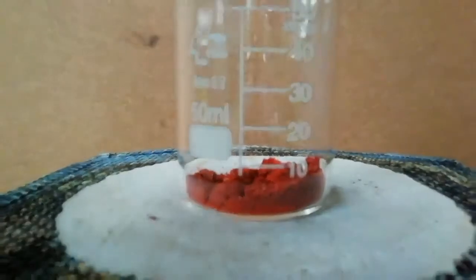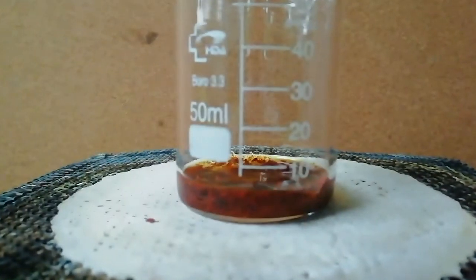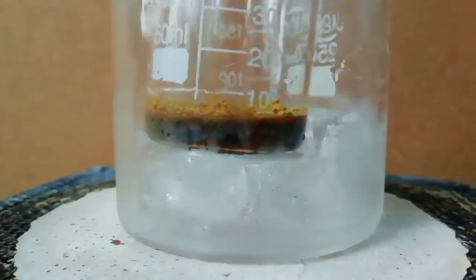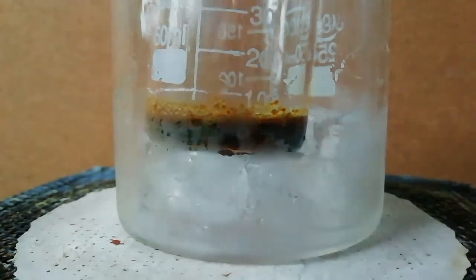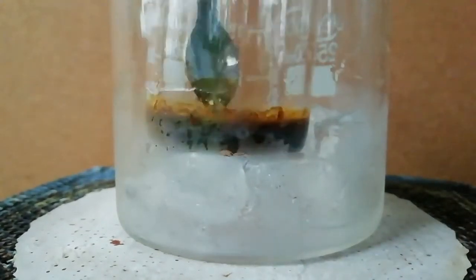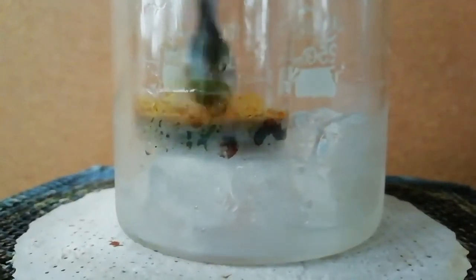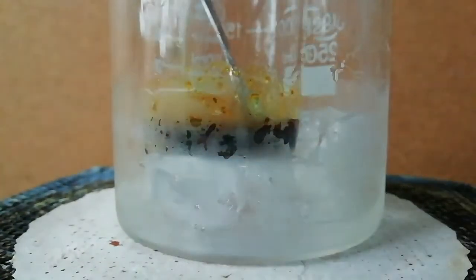For this experiment I use concentrated sulphuric acid, methanol, and 2,4-dinitrophenylhydrazine, also known as 2,4-DNP. First, I measure 2 grams of 2,4-DNP and mix it with 4 ml of concentrated sulphuric acid. Then I cool the mixture and slowly add 30 ml of methanol.